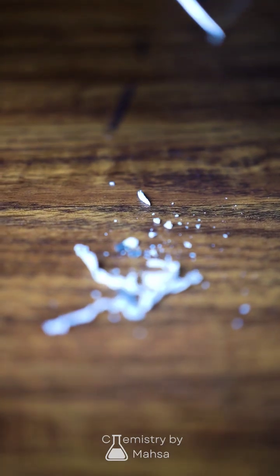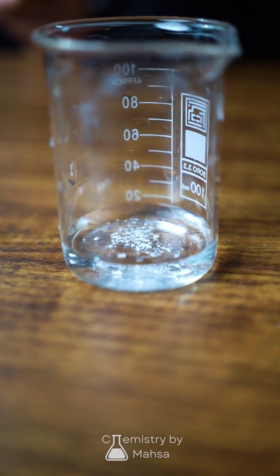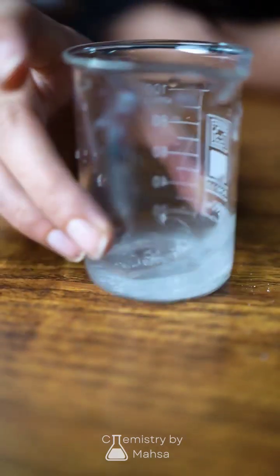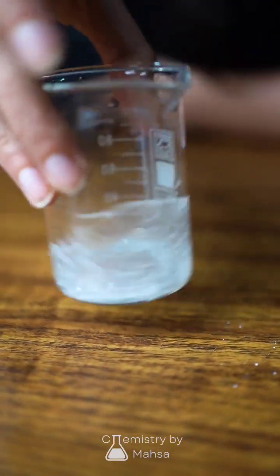Now once the magnesium has finished burning, we are going to take what's left over and dissolve it in water. And this is where things get really interesting. When magnesium oxide dissolves in water, it creates a basic solution.